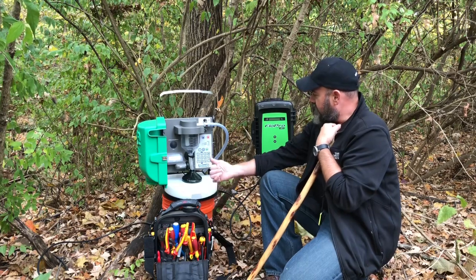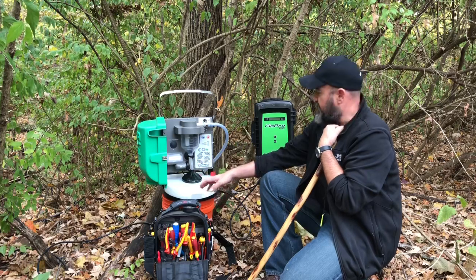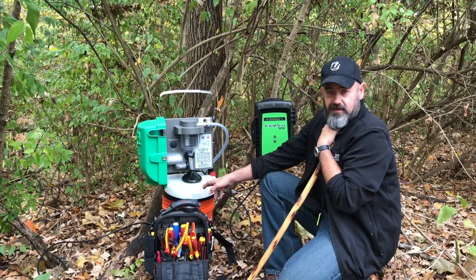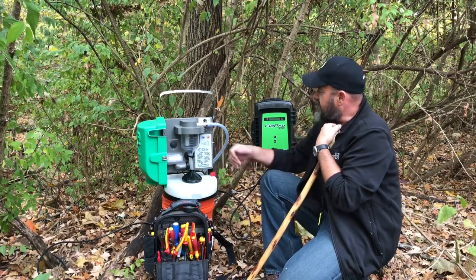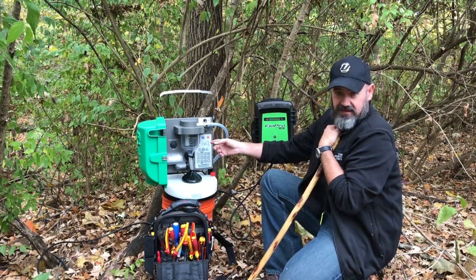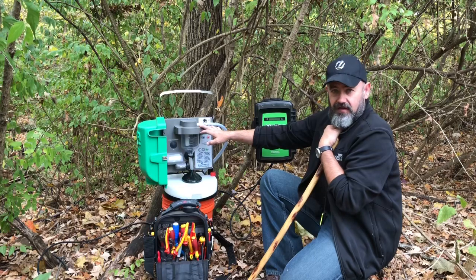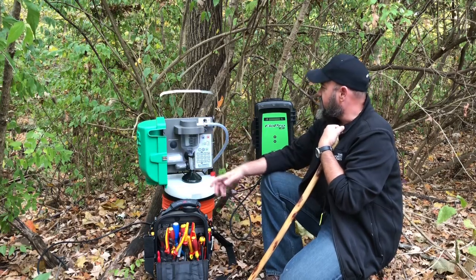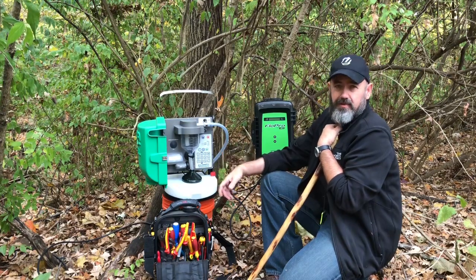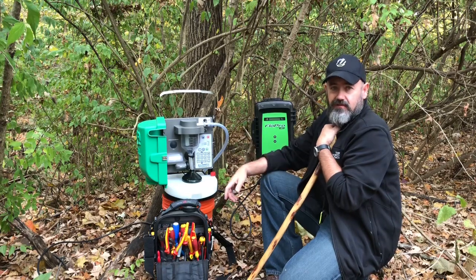What's neat about this one is that it can be used for either a discrete or a composite. This is a composite container, so it holds about 5 liters of material. The idea is that this is going to measure what the water flow is. It's going to signal to this so that this knows what the flow is, and this takes a sample based upon that flow. So the idea is that we can get a measure of what this particular stream looks like and what kind of pollutants are in there based upon whether it's coming from rain or whether it's just the natural leachate from the groundwater.